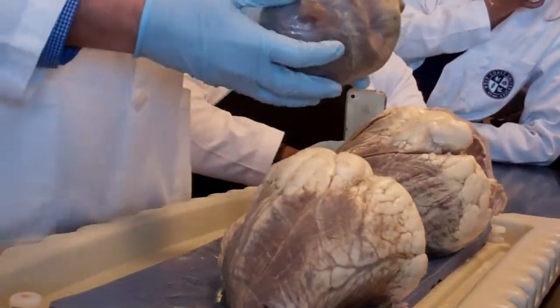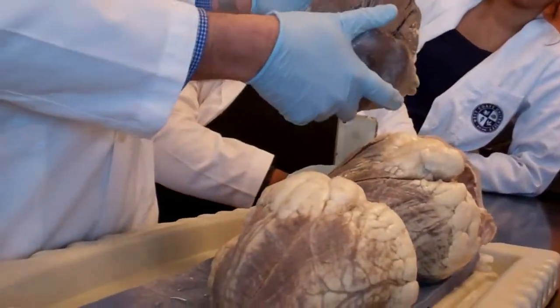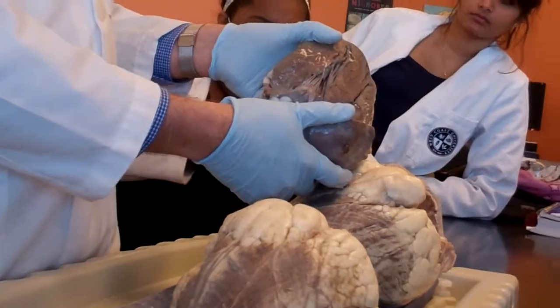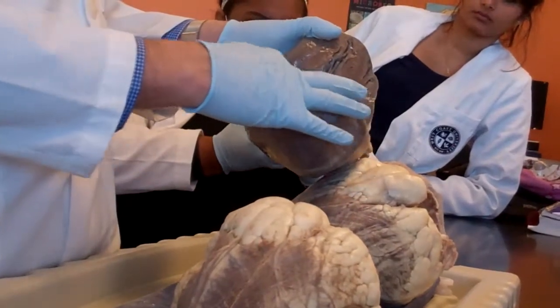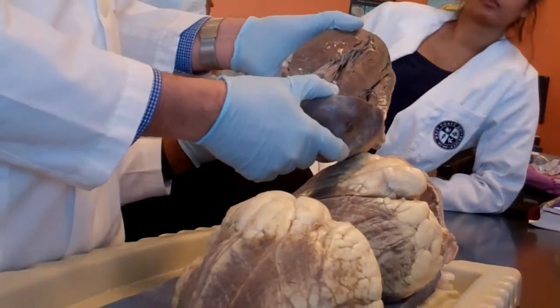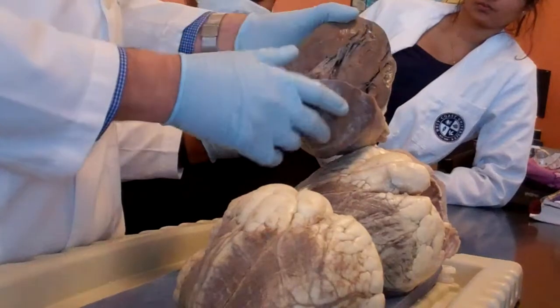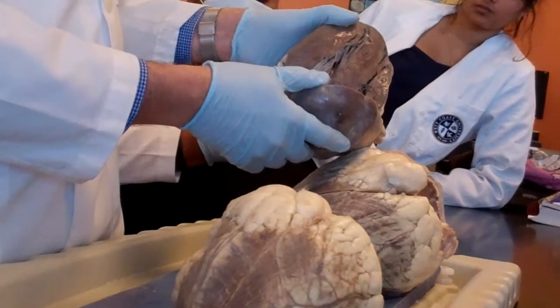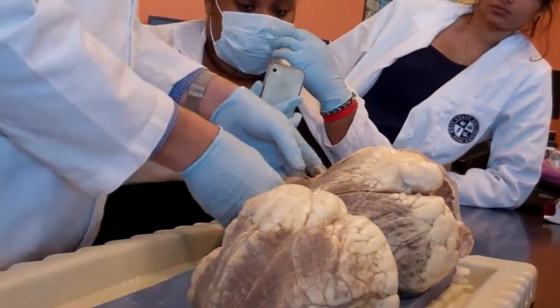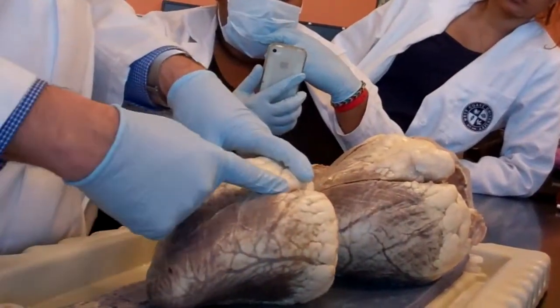Now, the reason I'm telling you that I don't like this dissection is because it's cutting the heart into 2 like this. Now here it's harder to identify. Why? Because you don't know where is anterior, where is posterior. You just see the walls, and that's all you can see here. But to really identify the chambers of the heart, I'm going to make a cut here.